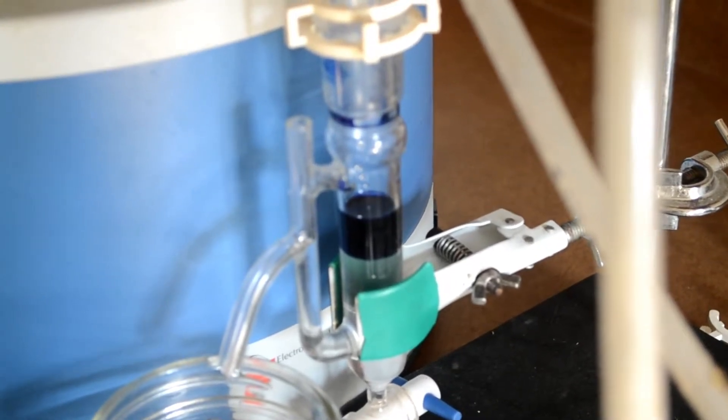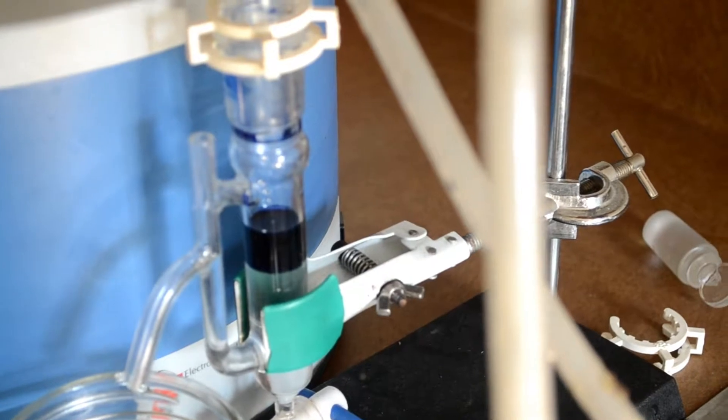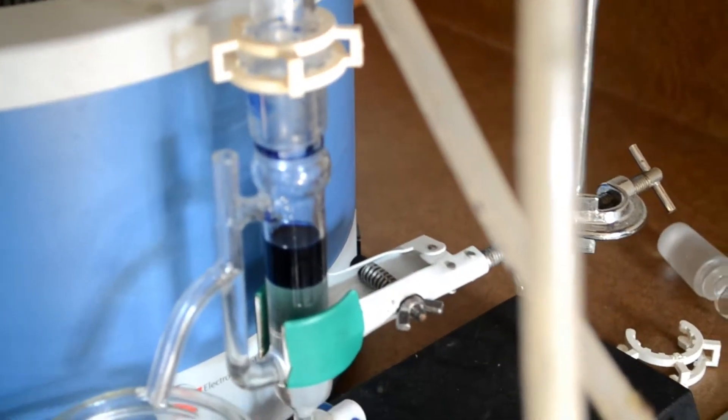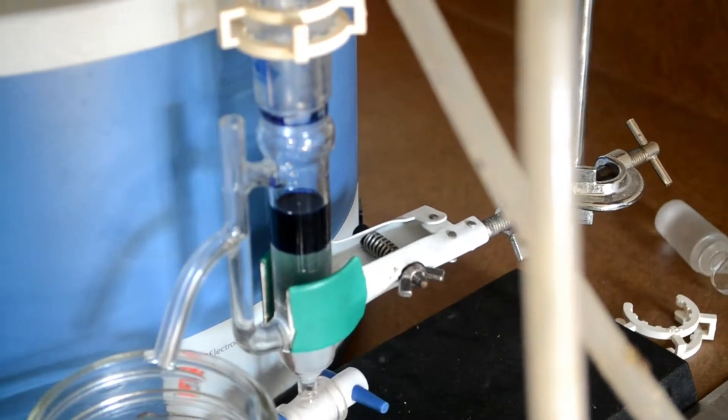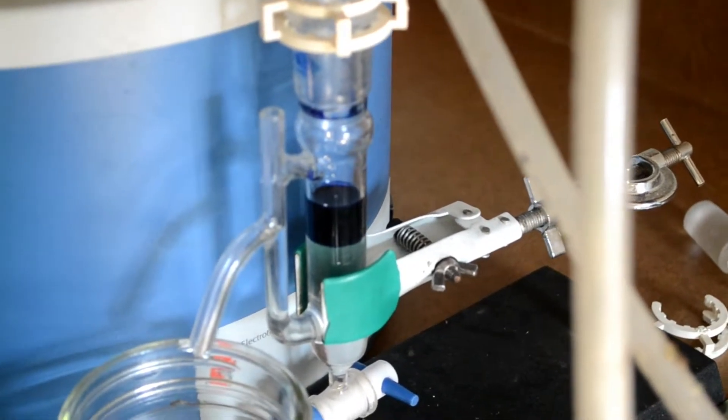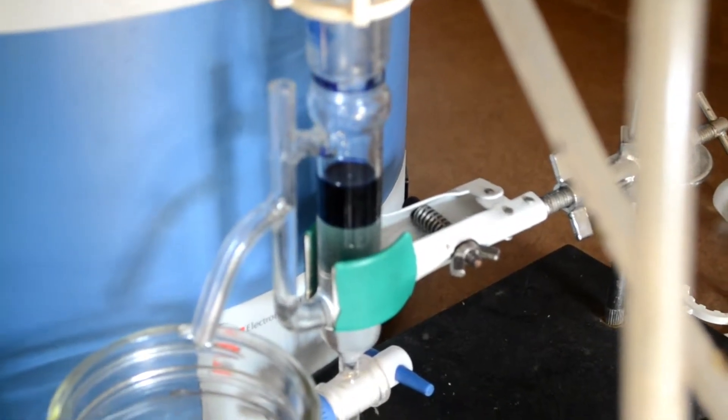You can see how the oil is nice and concentrated. Like in my last video, the collection flask was just a bottom flask and it touches a lot of sides on the way up that flask and collects differently than it does in here.